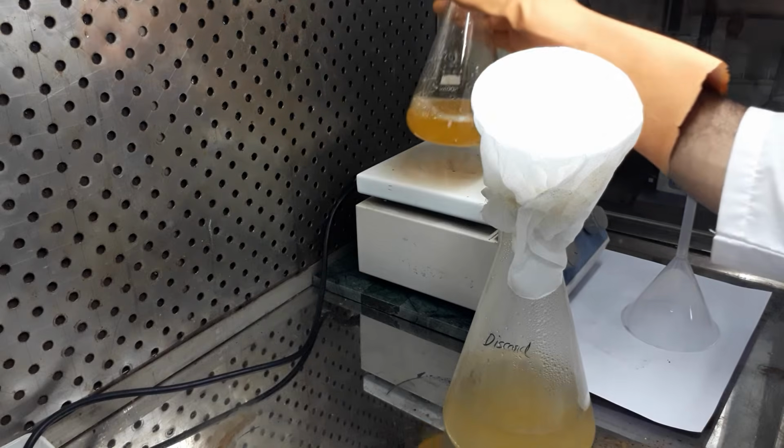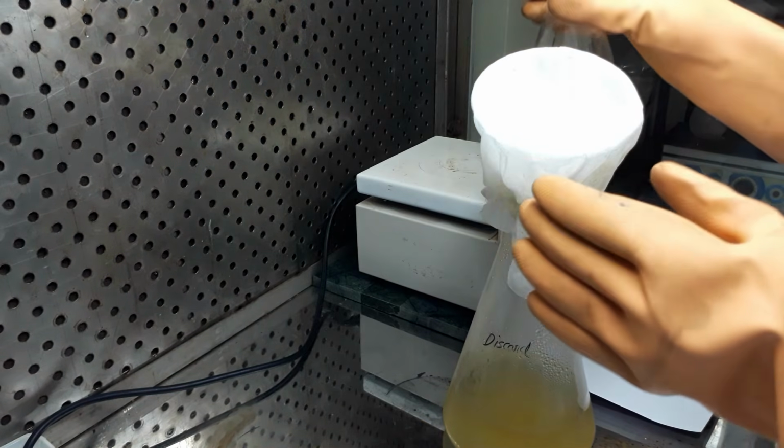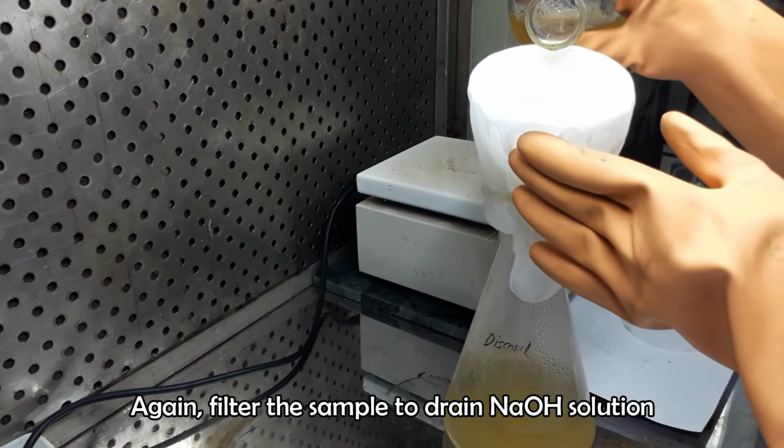After boiling, filter the sample using cotton cloth and wash it with hot water to remove the sodium hydroxide residue completely.